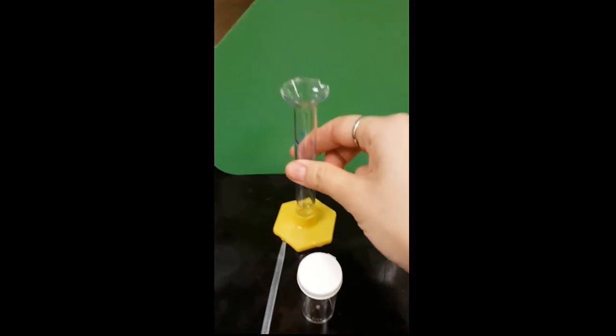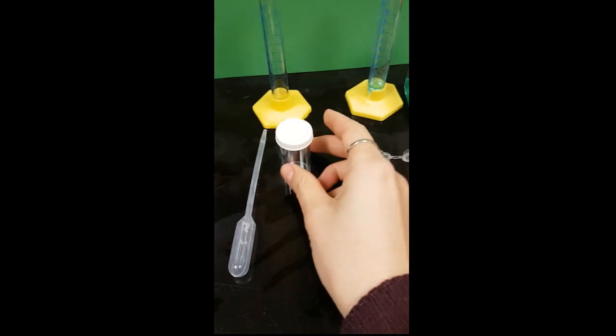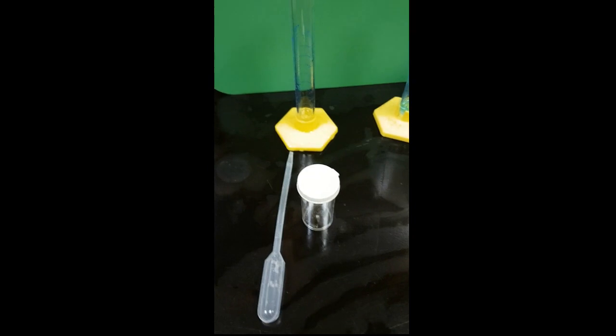And then the other one is hydroxide, sodium hydroxide. We have a container, a vial here, a plastic vial, and we also have this to help us.